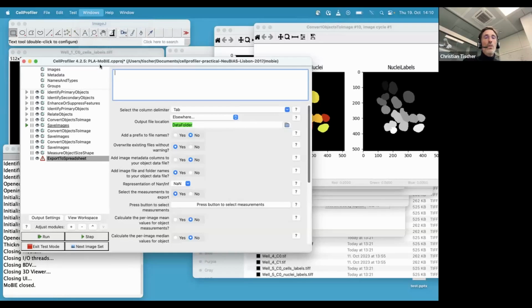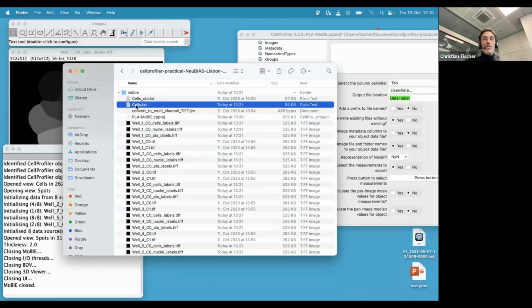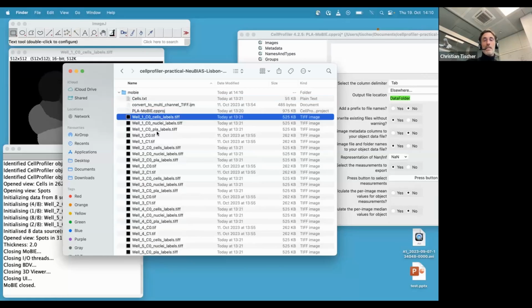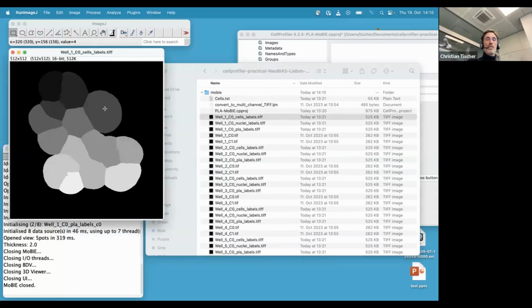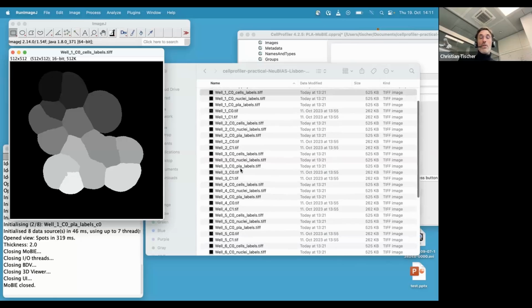I'd close all open windows, and then what you would get is a folder with a table which contains information about all the cells, and these label mask images, right? And just to make the point again, I opened one of them in Fiji, so this is how they should look like. So this is label mask images. And actually, this is also something where you then could go on in Fiji. For example, MorphoLibJ would happily work with these label masks for you if you want to do further measurements in Fiji.